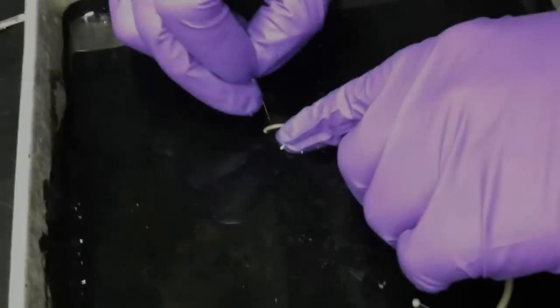In this video, I'm dissecting a nematode worm. This is Ascaris, which is a human and pig parasite.